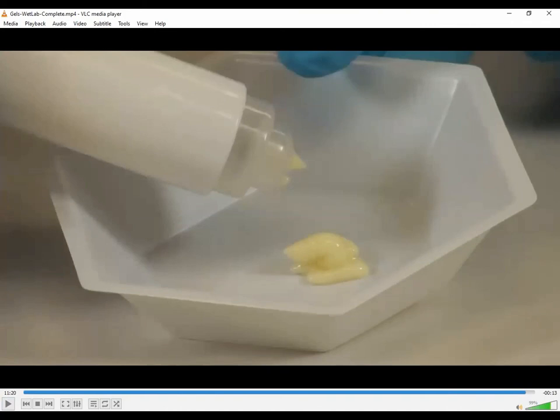All right. Now you got to go back to that worksheet. To finish up the worksheet at the end, you also have to determine the weight of 20 squirts. So to do that, you put a weigh boat onto your balance, hit tare, and then count out 20 squirts. And then you'll use the weight of those 20 squirts to calculate essentially the volume per squirt on that worksheet.